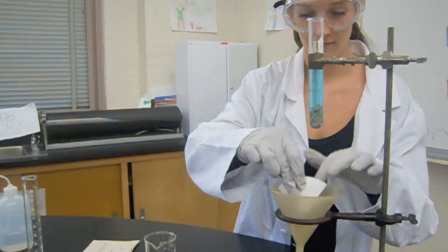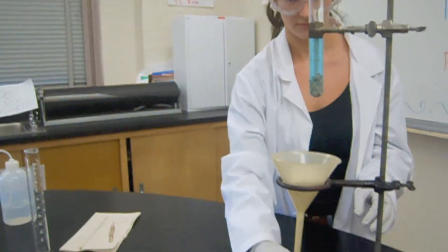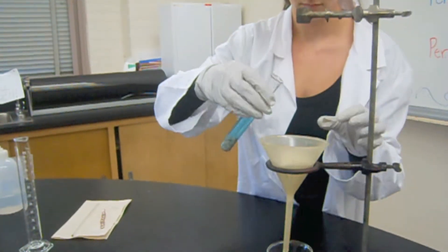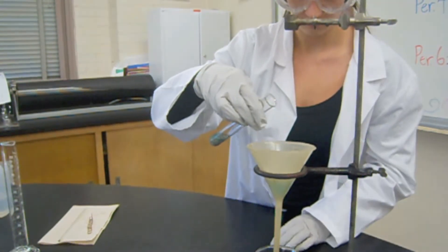Place the filter paper into the funnel. Pour the contents of the test tube through the filter paper and down the funnel into the beaker.